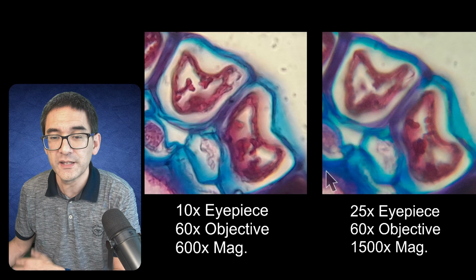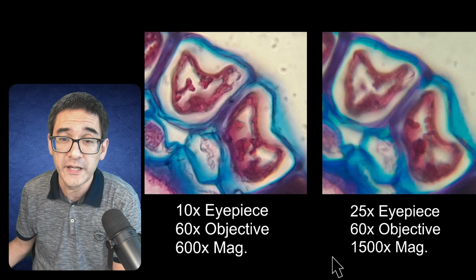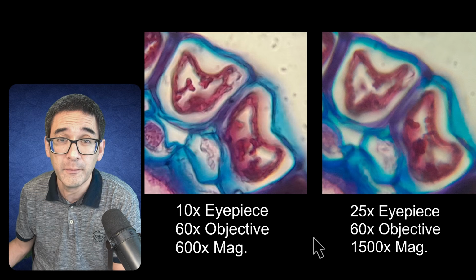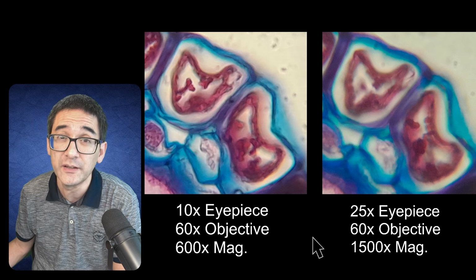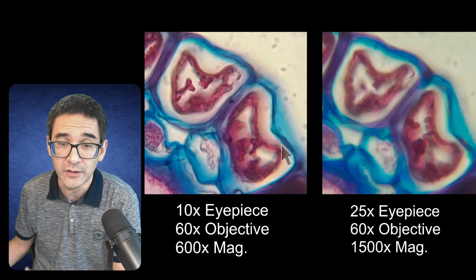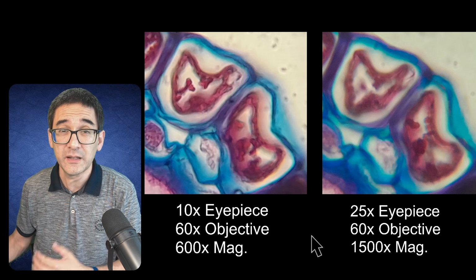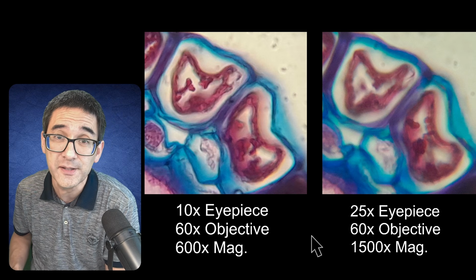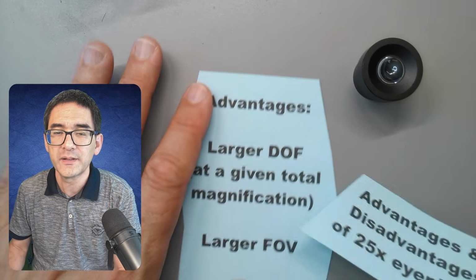Right. And the reason is that essentially with the 1500 times we're already way above what microscopes are able to resolve, and maybe we also have some optical issues as well. Maybe the eyepiece lens also contained some aberrations and lens errors, and all of that added together actually results in the image becoming less clear than with a lower magnifying eyepiece. Yeah, so this already shows that at least concerning image quality, we're not really gaining anything by using the 25 times eyepiece. So now let's look at the advantages and disadvantages of 25 times eyepieces.